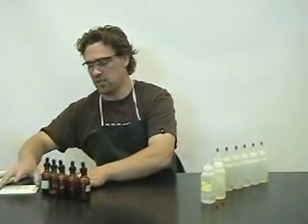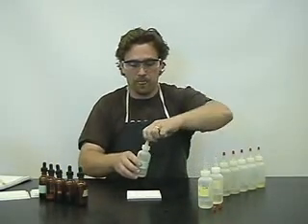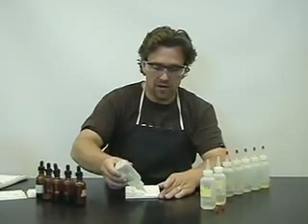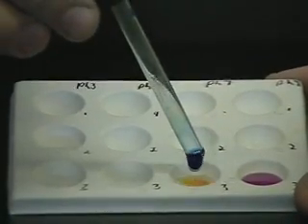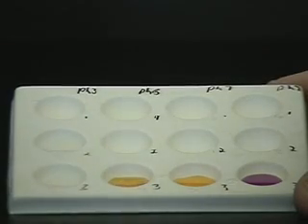Because testing all of them would take a long time, we're going to test one of the unknown acids with our various indicators and work through it together. We're going to put a bit of unknown acid 1 into five spot plate dimples, then add indicator 1, indicator 2, indicator 3, indicator 4, and lastly indicator 5.